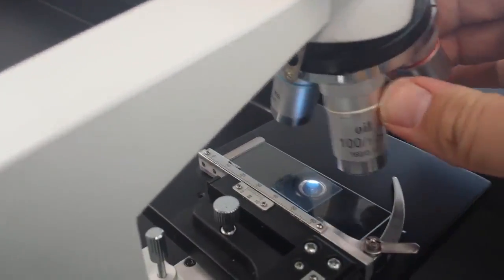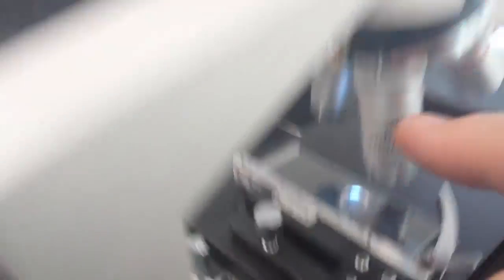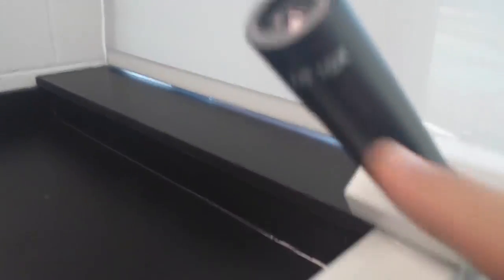And I should say I want to use the extra high power oil immersion. This is 100, and then with the 10 power, this is 1000 power.